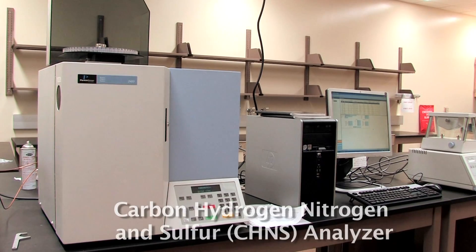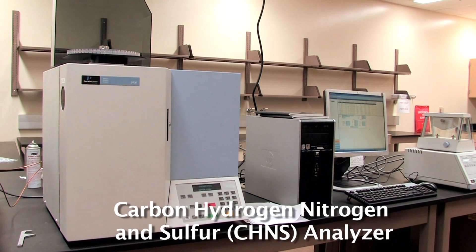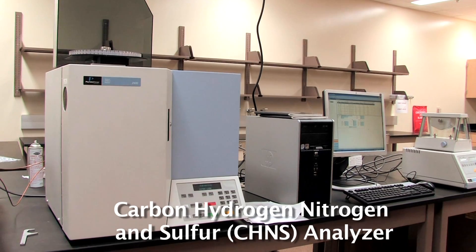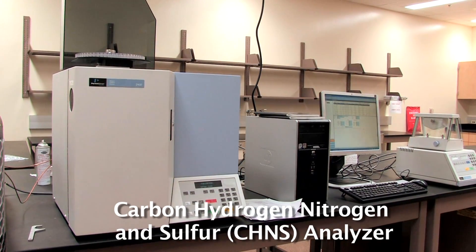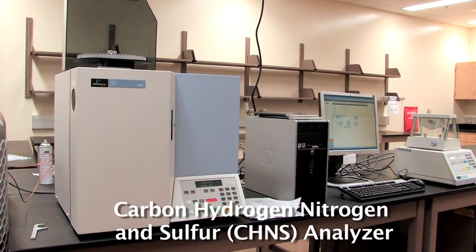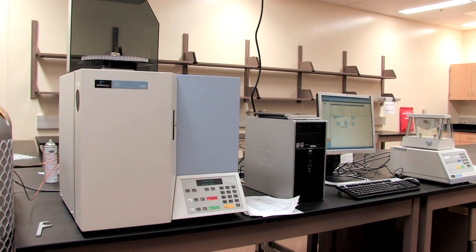The carbon, hydrogen, nitrogen, and sulfur analyzer examines the percent of each of these elements from powdered samples, such as tires, rubbers, and pharmaceuticals.